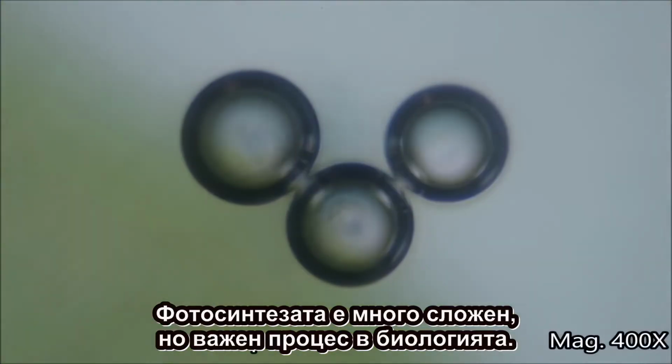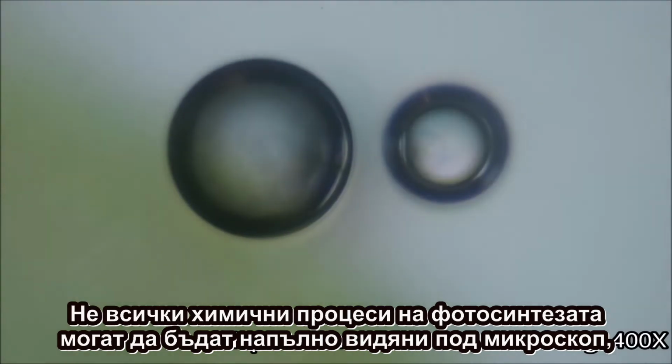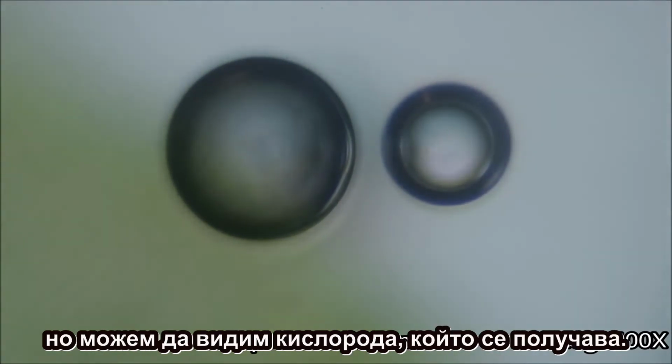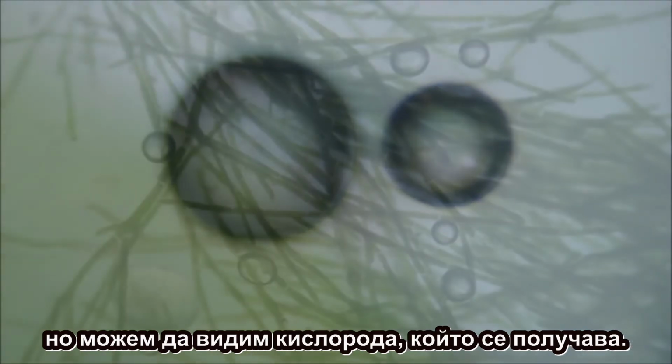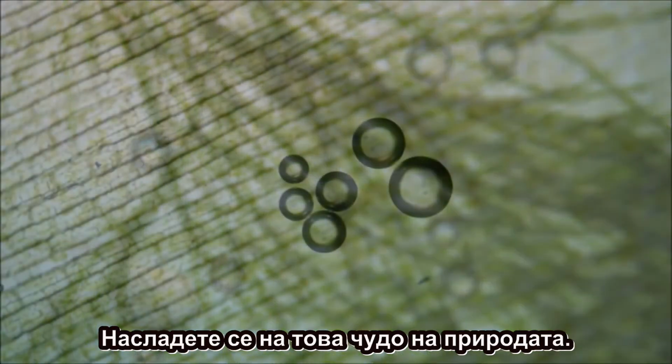Photosynthesis is a very complicated but important process in biology. While all of the chemical processes of it can't be completely seen through a microscope, the oxygen produced at the end is, and when the footage is sped up, it produces very beautiful videos. So enjoy this biological marvel.